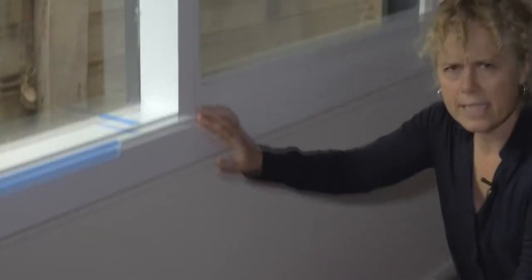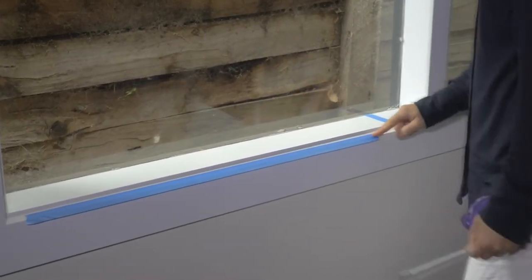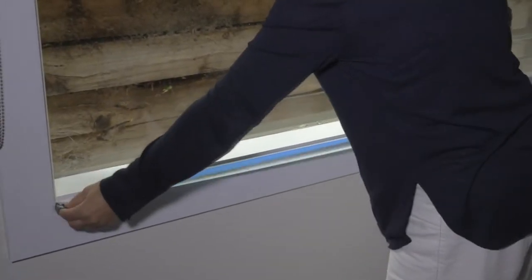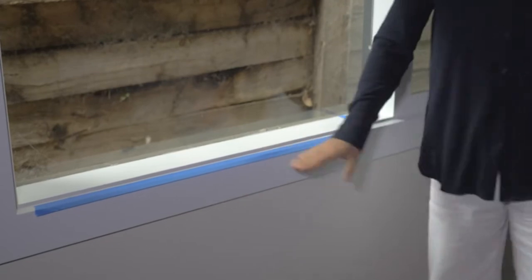Windowsills can be a little bit tricky because they can be quite narrow. So with this, you're going to do something like a 90 by 10 centimetre surface area. And that's what this looks like here. The way I measured this was to get my measuring tape up to 90 centimetres, and then I just put this masking tape on, and then 10 centimetres came to about here. So without disturbing the sampling, I'm being mindful that I'm doing it like this without actually touching the surface, and then using my masking tape as the perimeter.